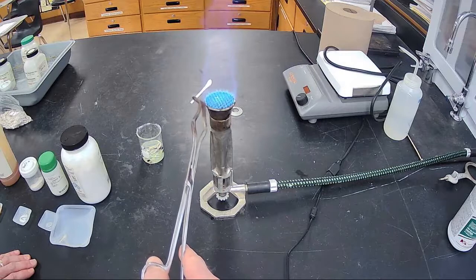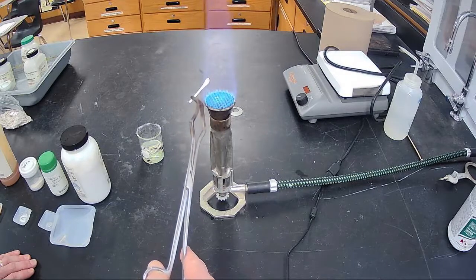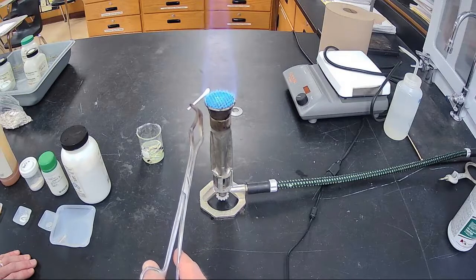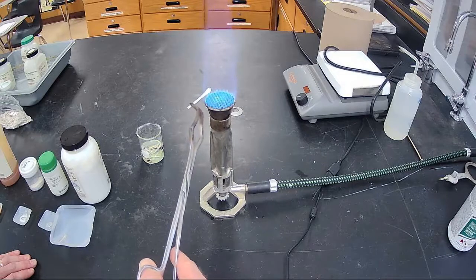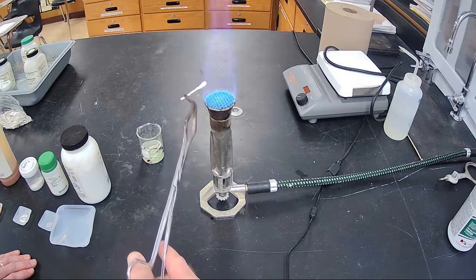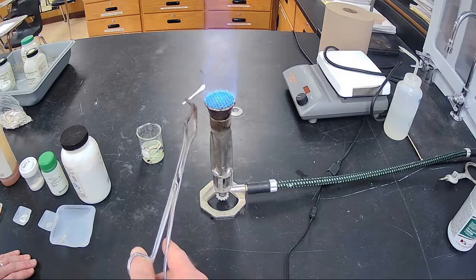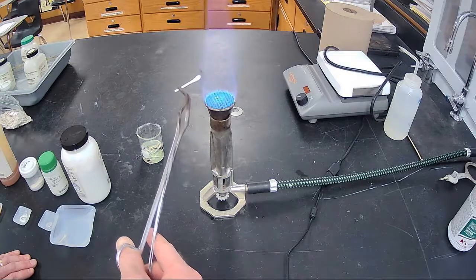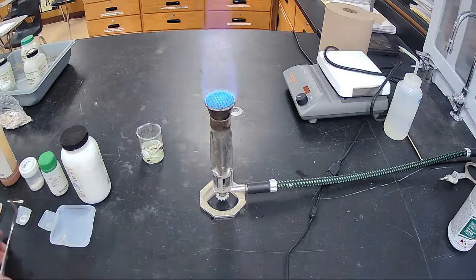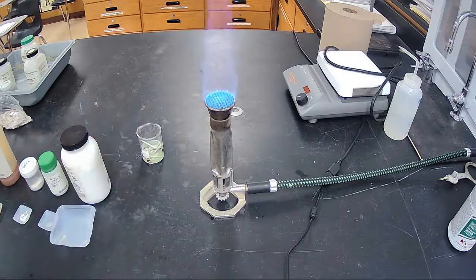Let the salt get going here a little bit. Really hard to see. We'll try that. Oh, I dipped the wrong one. We'll try that again.